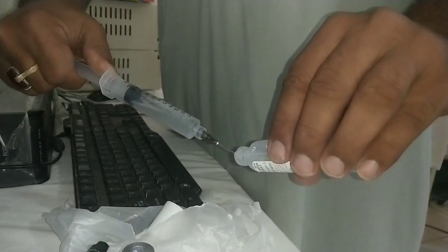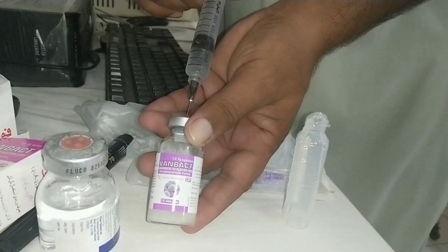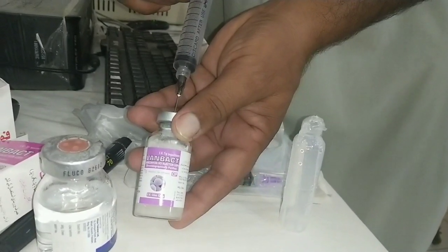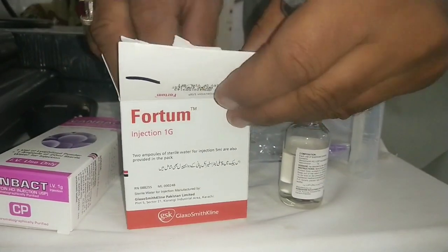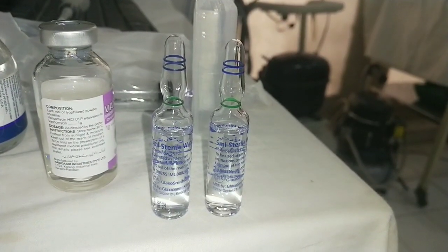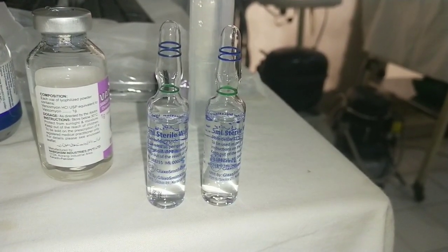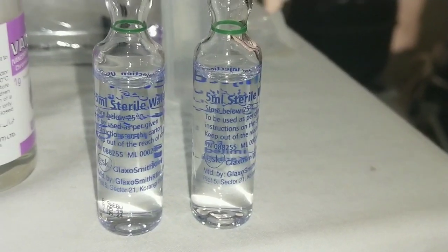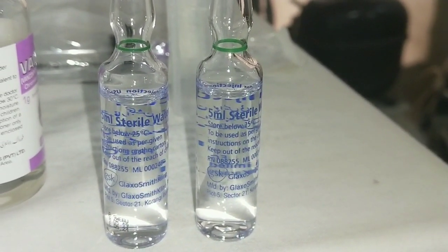You must mention the date of preparation and date of expiry for all fortified drops — seven days expiry if stored in the refrigerator, and four days expiry at room temperature. These drops can be used one hourly or according to your prescribing doctor.